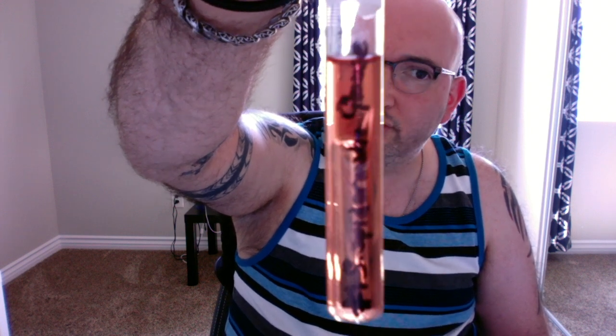But this S. epidermidis, because the color itself hasn't changed, and there are no real bubbles in here, this is considered a non-fermenter. There's no change in pH, so there's no fermentation, no gas, nothing happened here.